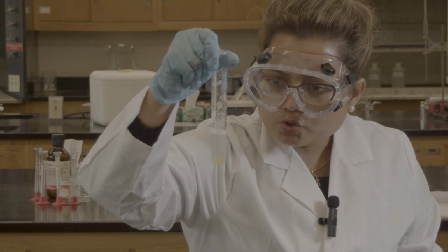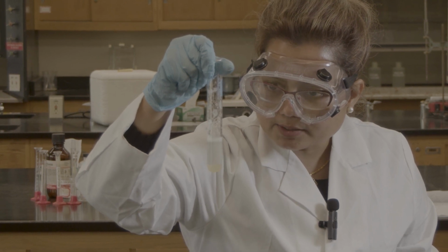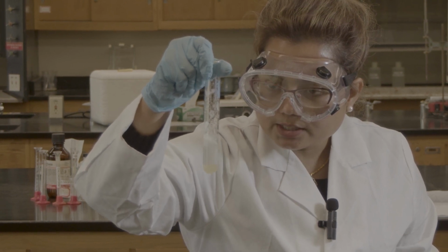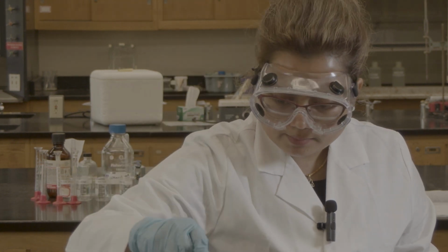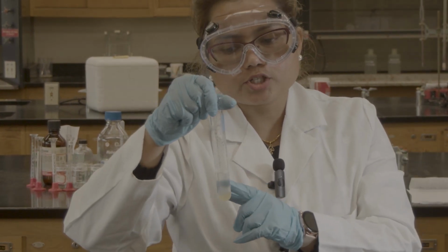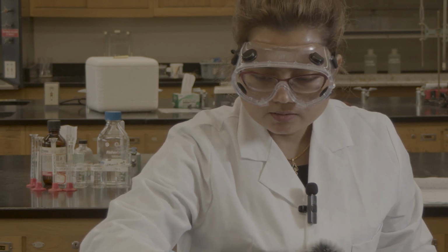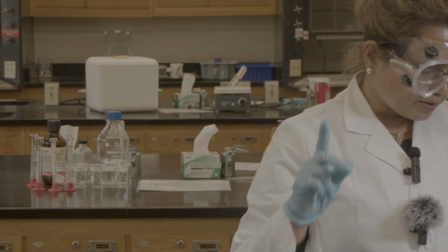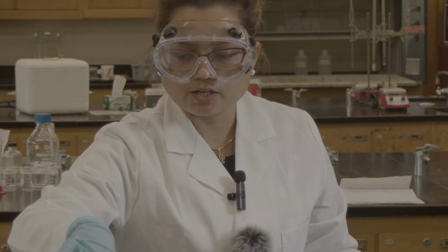So it's not totally soluble yet, but we will check. Some of the amount is soluble inside the water. But I will come back. So at room temperature, you can say that it's not totally soluble. So we will observe in cold water and hot water. What I'm doing right now is for cold water.